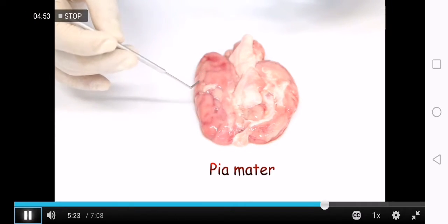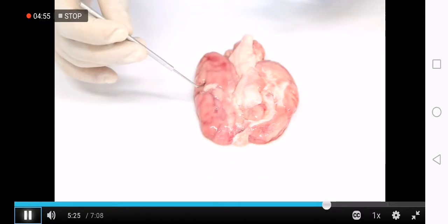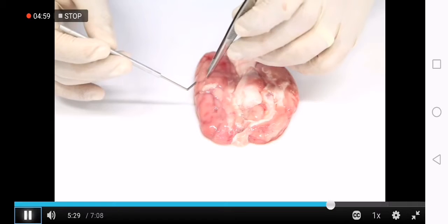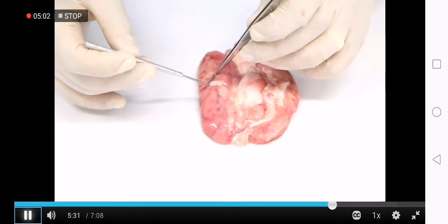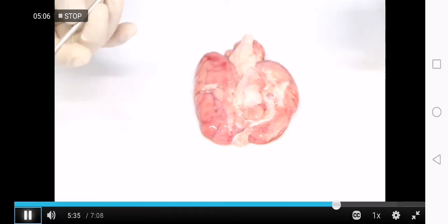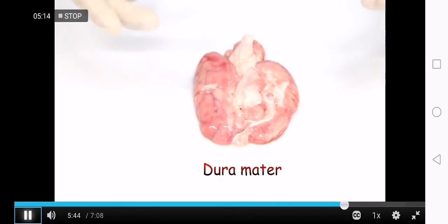You may find it in your specimen. Sometimes you can still find it in certain specimens. So the tissue or the lining that is most adherent or closest to the brain is your pia mater. The thicker tissue or lining covering the brain is the dura mater.